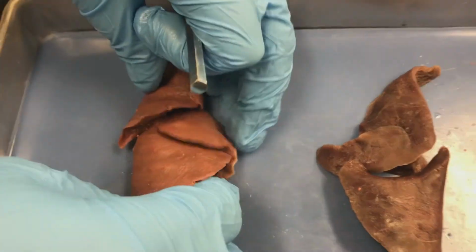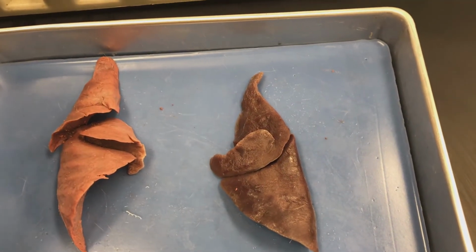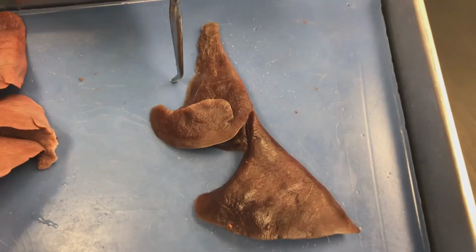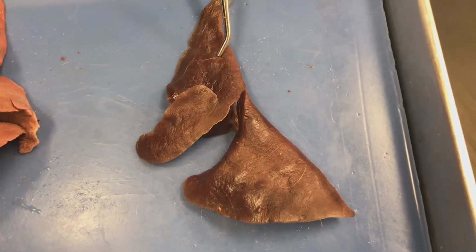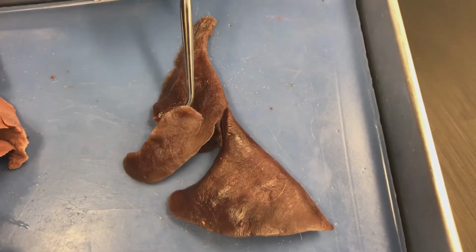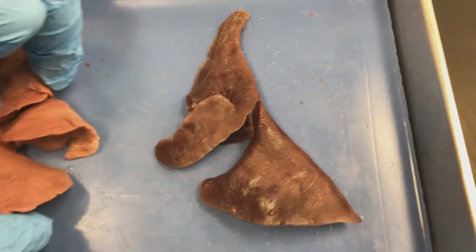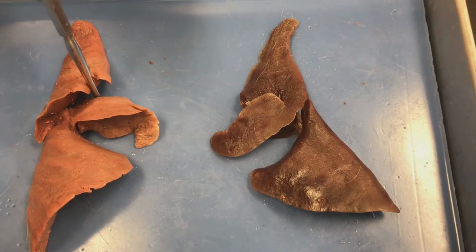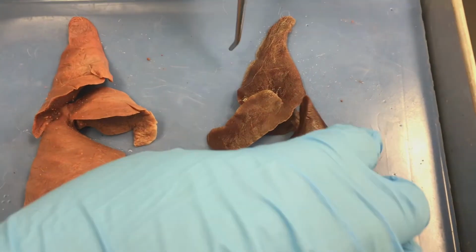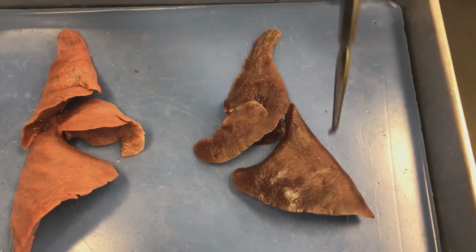That's different from the left lung. Now many people think when they first dissect it, hey, there's 3 sections, there must be 3 lobes. But this left lung only has the 2, and you see this has a section here and here. But this superior lobe is connected here, so it's just one lobe, even if it is somewhat separated lower. But they are connected directly, which makes this the superior lobe. So on this side, your right lung has the 3 lobes completely separated. And then on your left side, you have the superior lobe that's connected here, and then your inferior lobe down here.